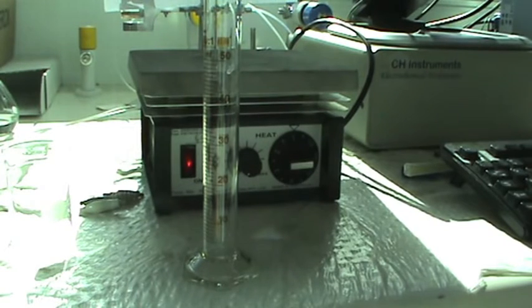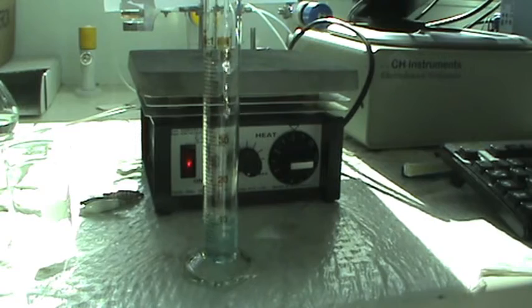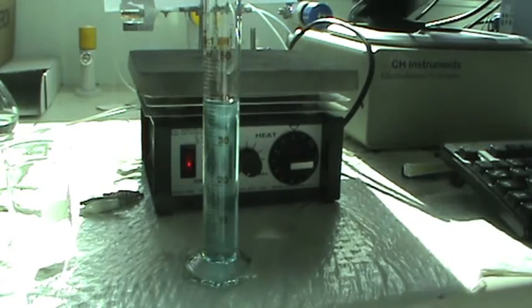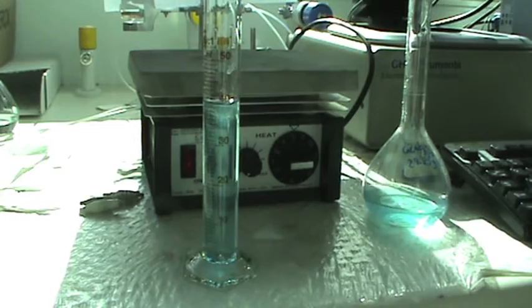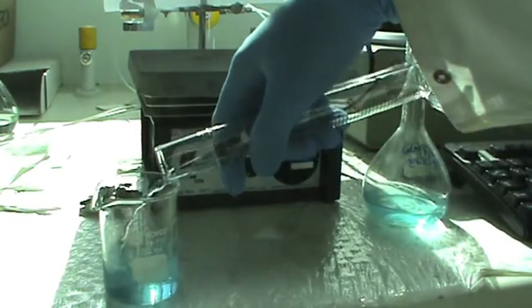Now, we need to measure out 40ml of copper nitrate. Get the measuring cylinder and measure out 40ml of copper nitrate, then pour the contents into the beaker.